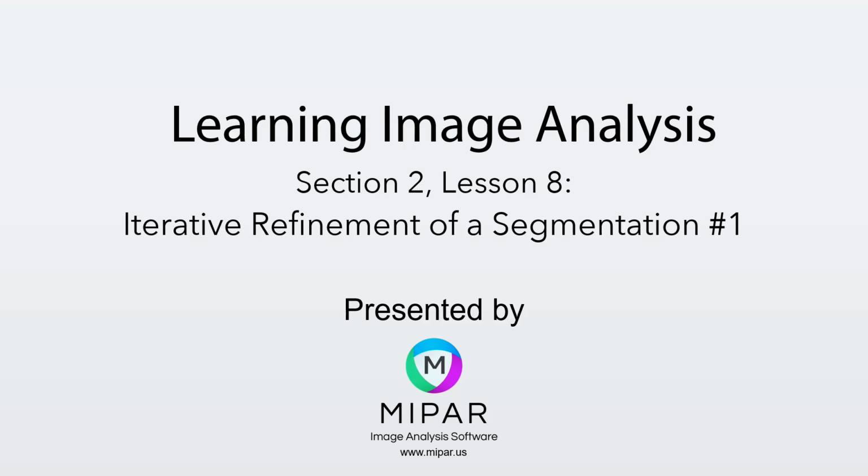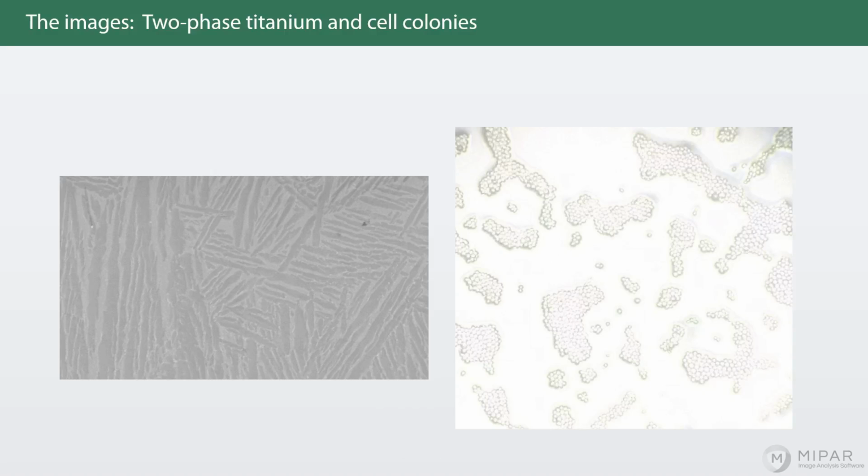We have two images, both of which we've handled before. On the left is two-phase titanium. We have the dark alpha phase and the bright beta phase. And on the right we have colonies of cells. And in both of these, our previous segmentations had a few errors that I want to address. So we're going to fix some of these mistakes, make the end result better, and make the end measurements better as well.